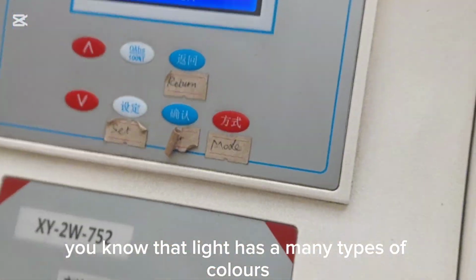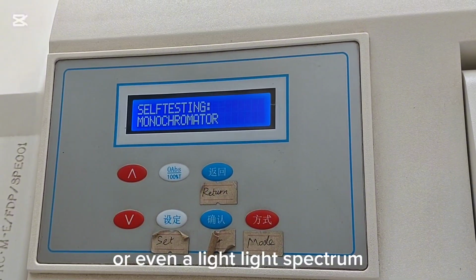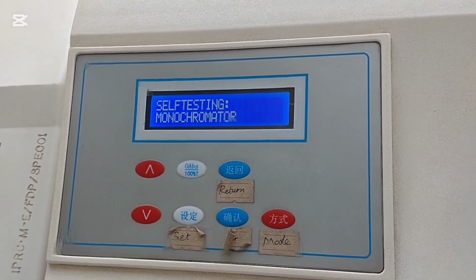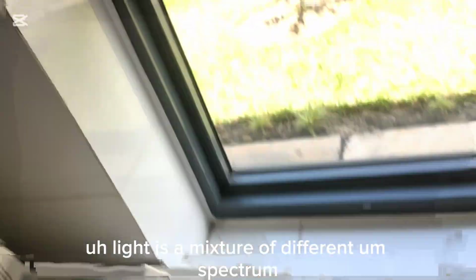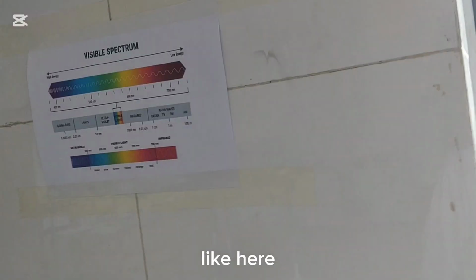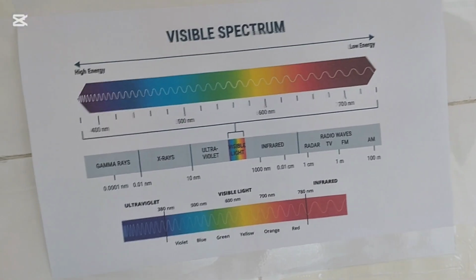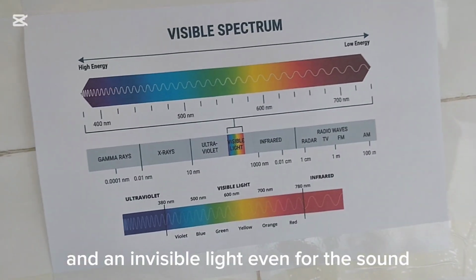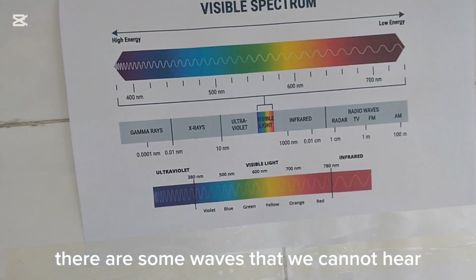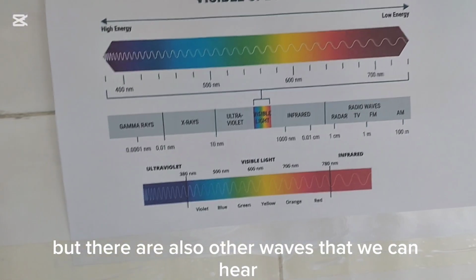You know that light has many types of colors, or even a light spectrum. Light is a mixture of different spectra. Like here, you can see that we have different types of light. There is what we call visible light and non-visible light. Even for sound, there are some waves that we cannot hear, but there are also other waves that we can hear.